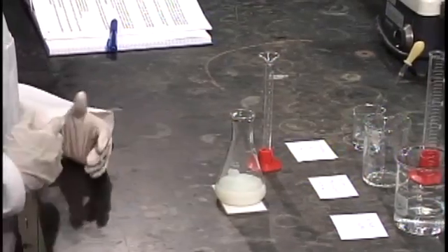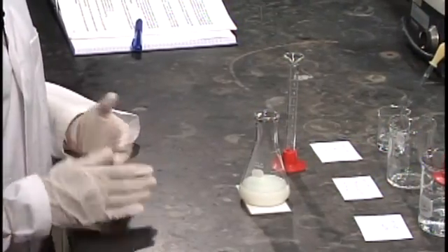Then we proceed with the same procedure using different concentrations and volumes.